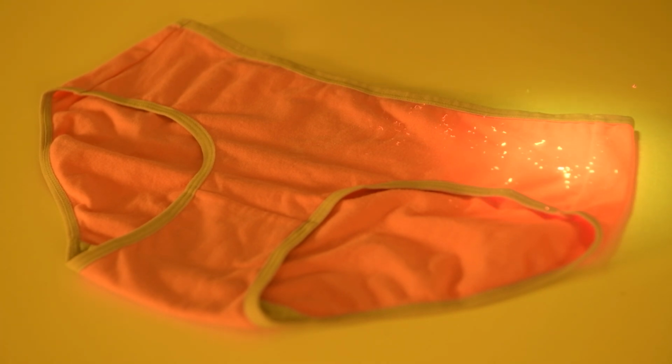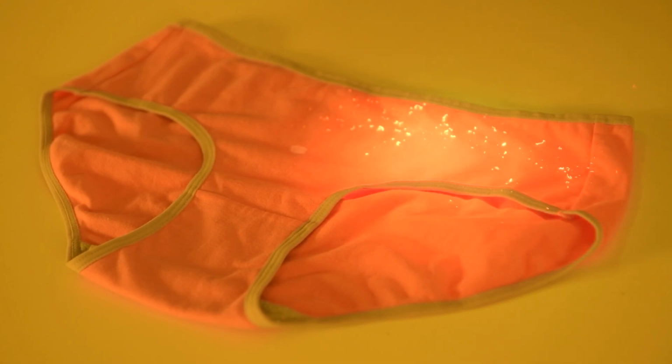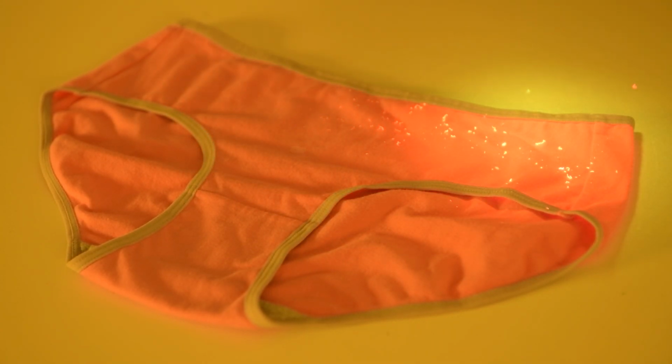The behaviour and fluorescence of fibres can vary hugely depending on their composition. They could fluoresce all the way across the spectrum under different wavelengths, purely due to the chemical composition and the treatment of that fibre. So if we're searching for different fibre types, one of the reasons it's really important to have a range of different light sources is that we don't know where that particular fibre is going to emit the best fluorescence. Having a range of light sources can be incredibly helpful for this.